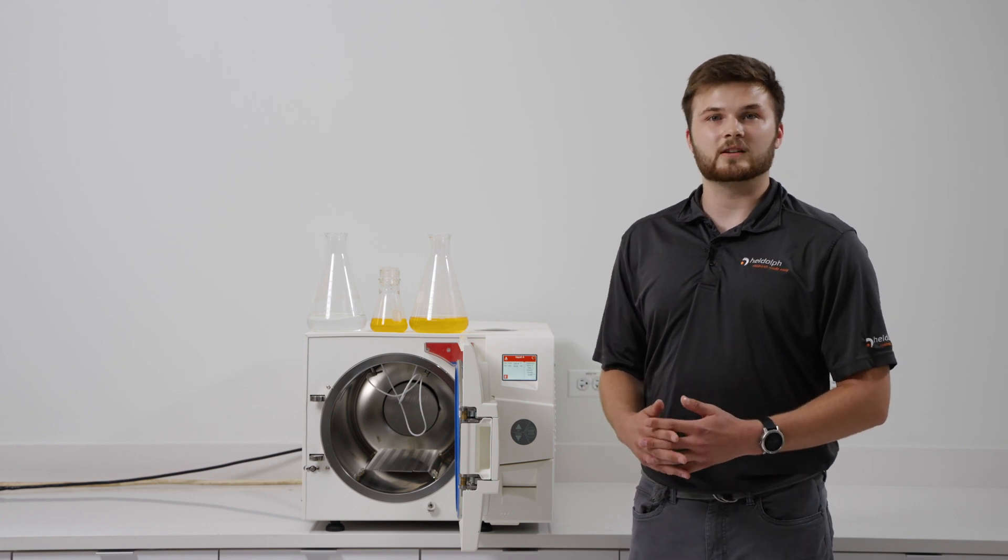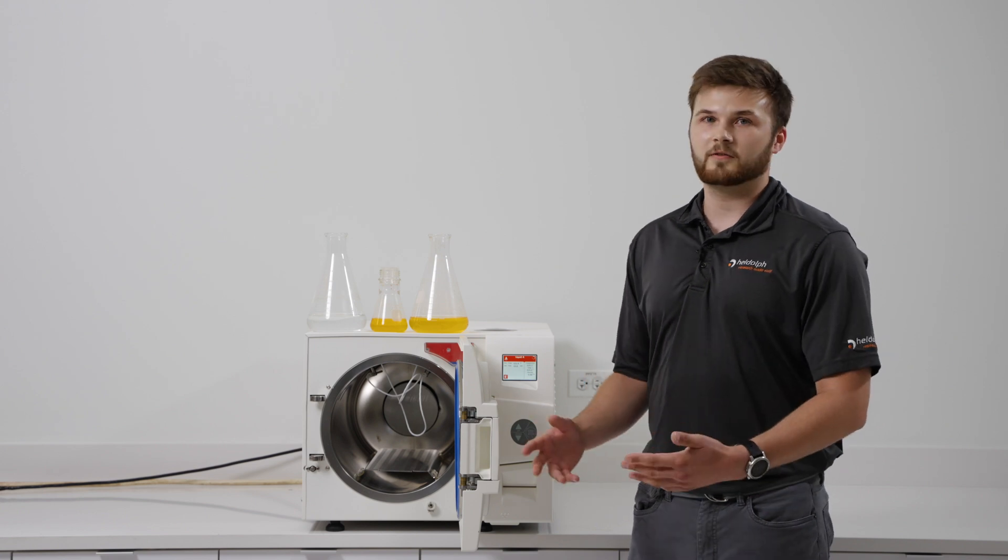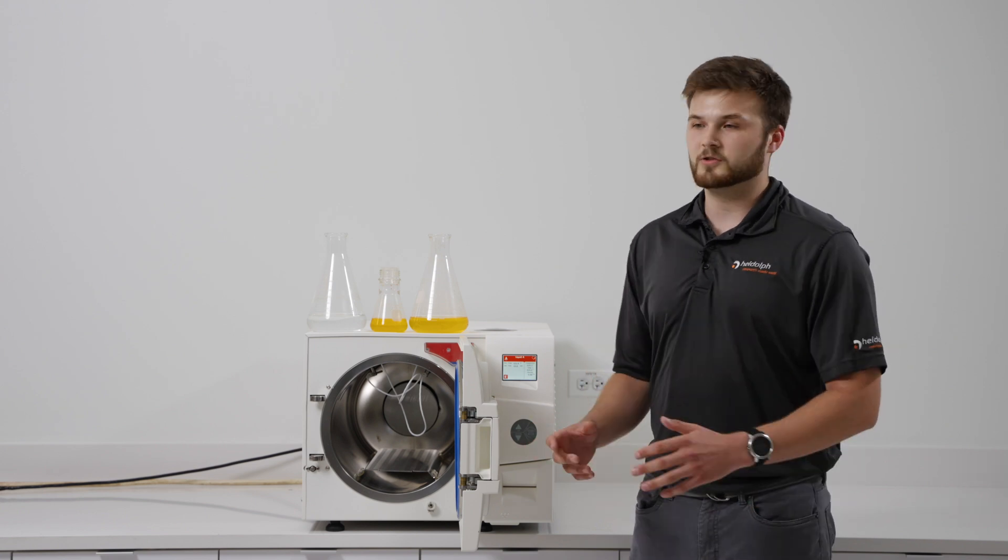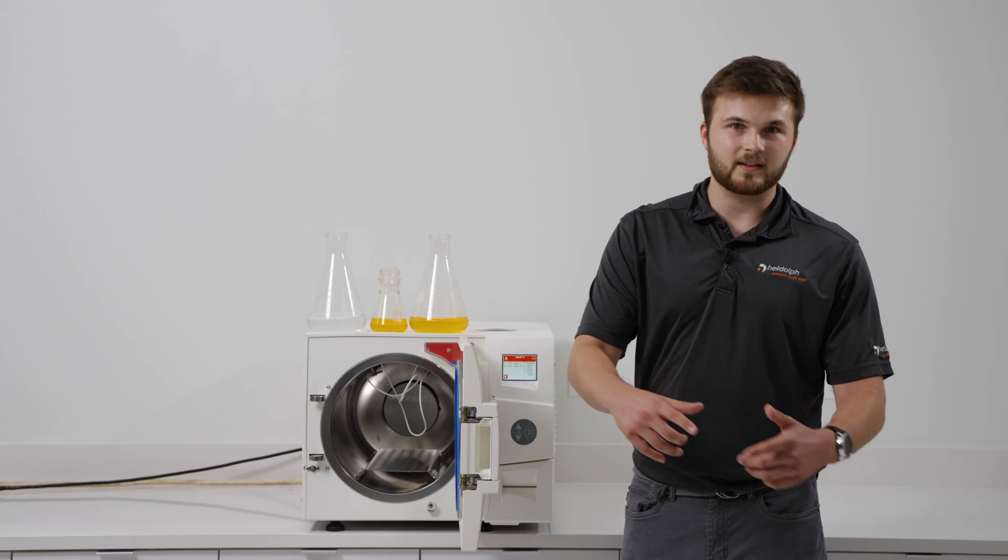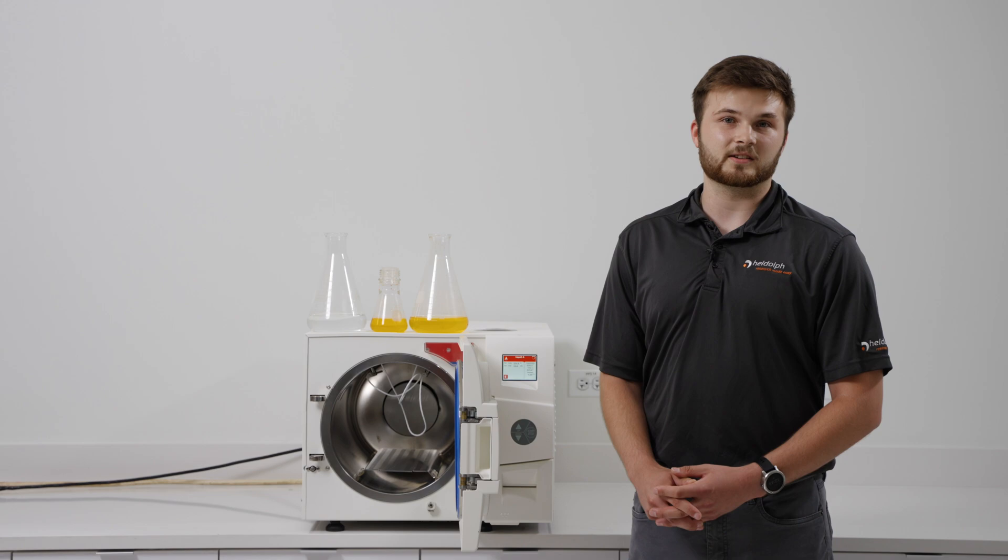This means that you do not have to create custom cycles based on the size of the vessel you are using or the amount of liquid that is being sterilized. The unit will automatically move into the sterilization stage once the internal temperature of the liquid has reached 121 degrees Celsius.